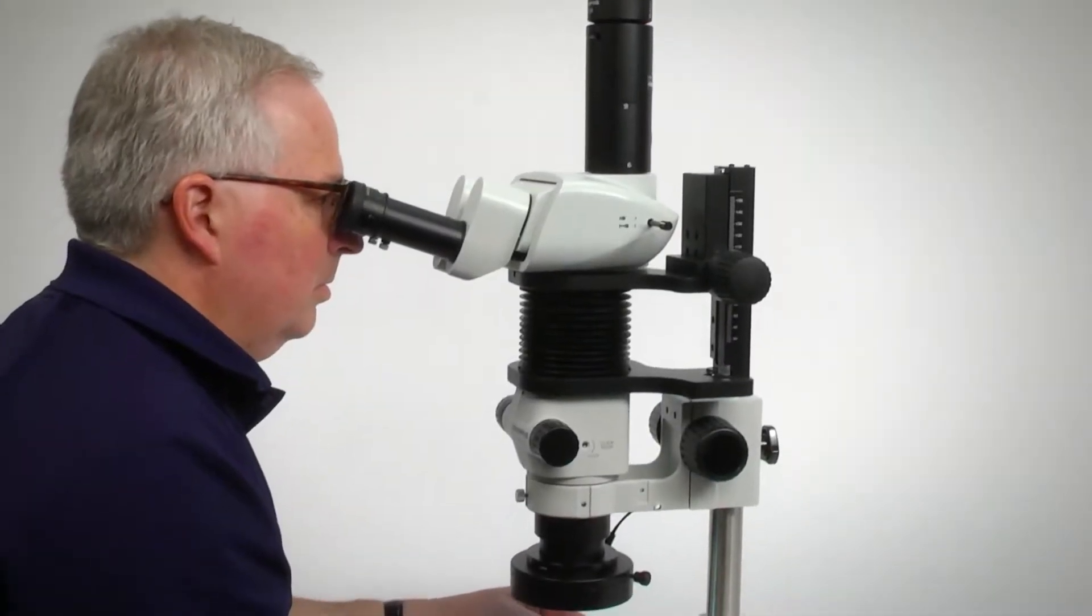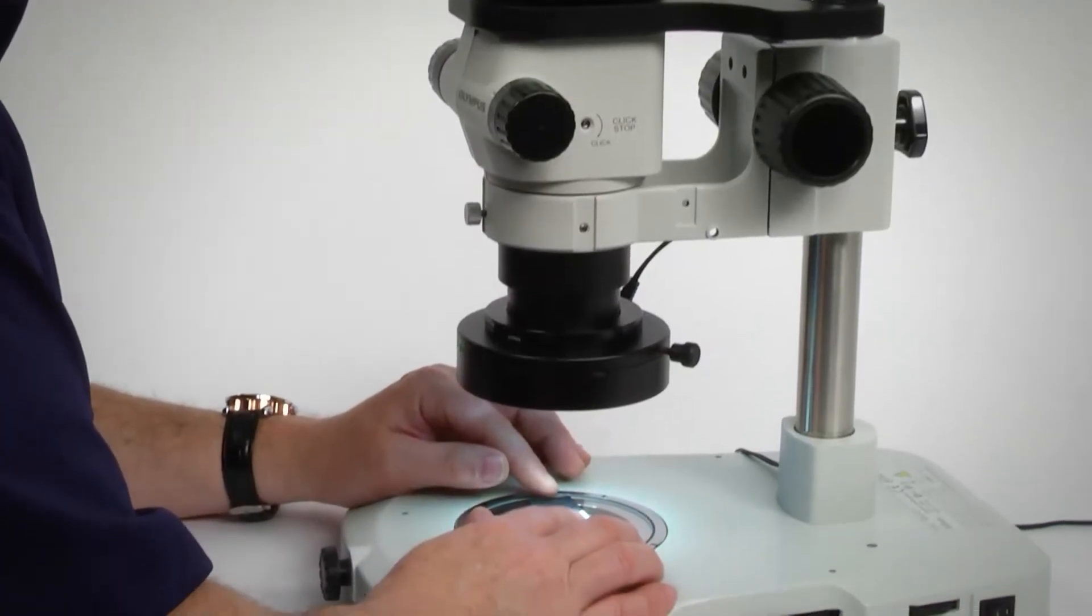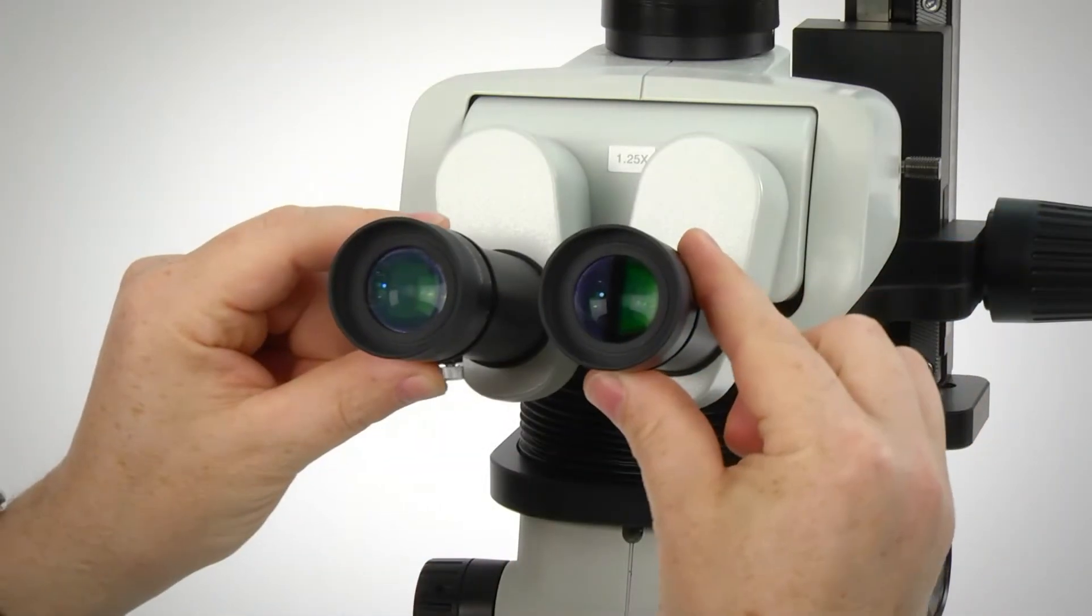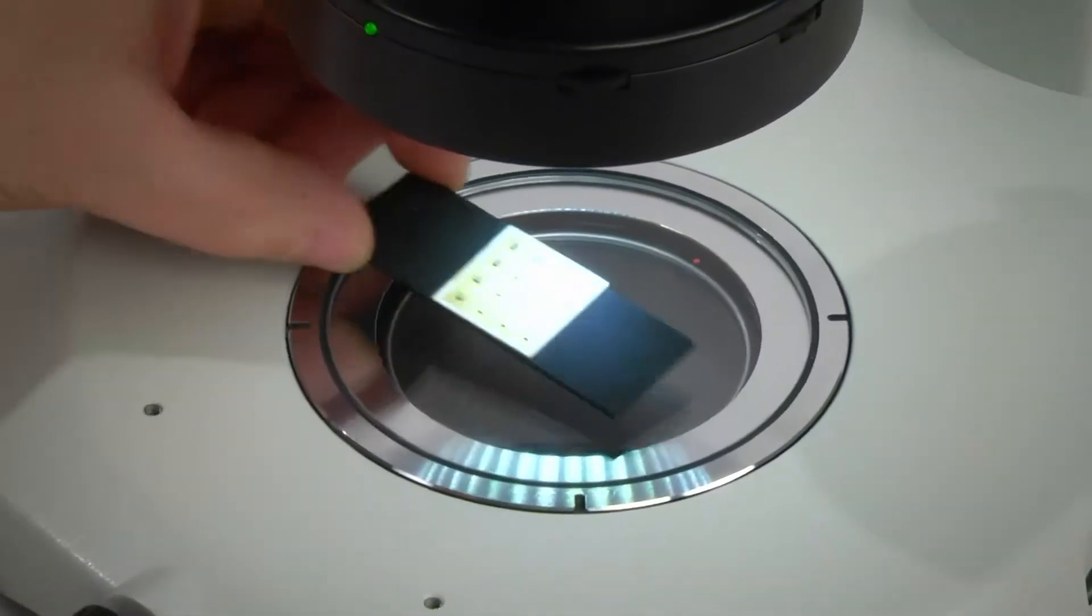Proper microscope setup is critical to help ensure optimal performance and safety when making observations or using a microscope camera. Proper microscope setup increases operator productivity and efficiency for a streamlined workflow.